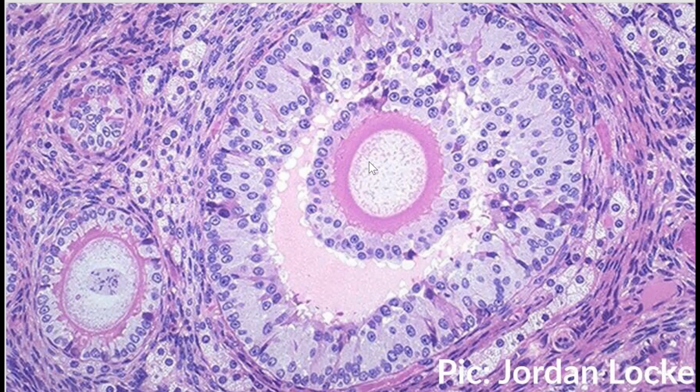So this is our secondary. This is our primary. Okay.